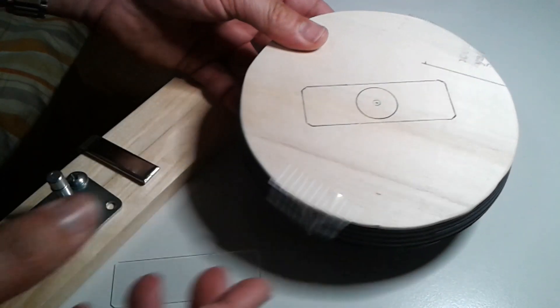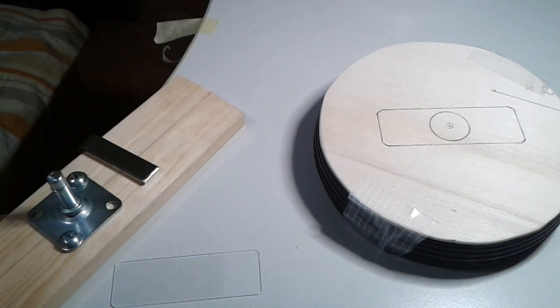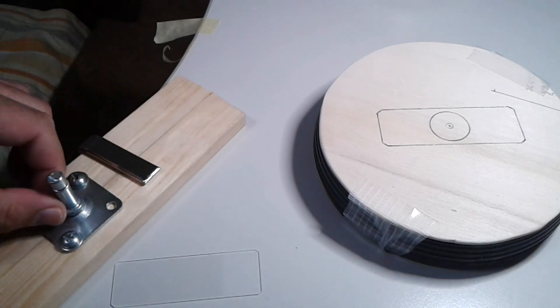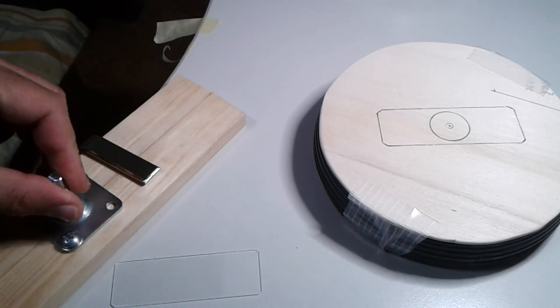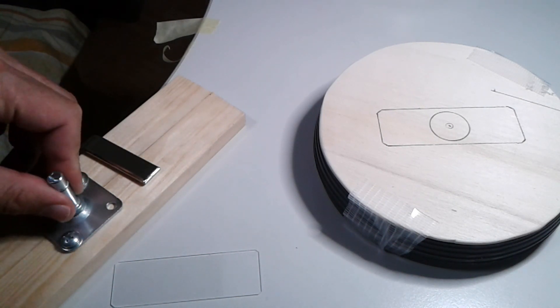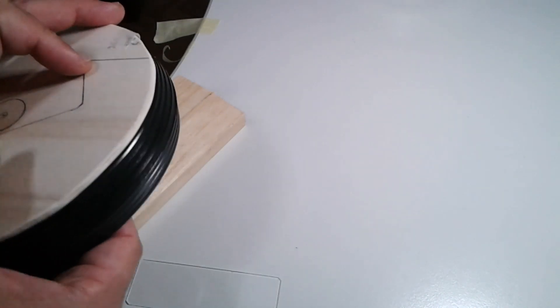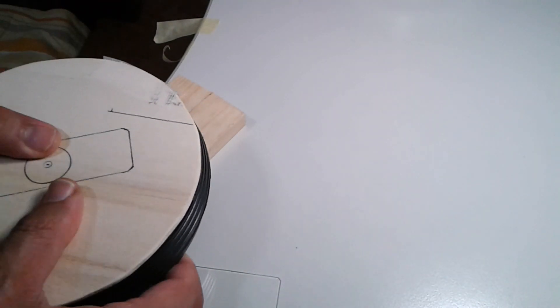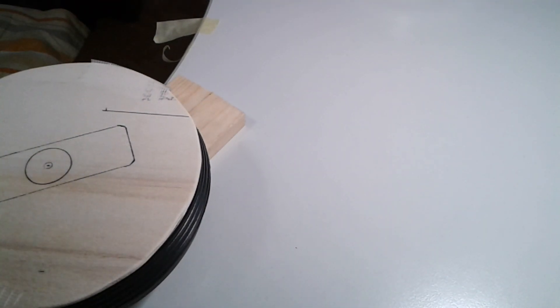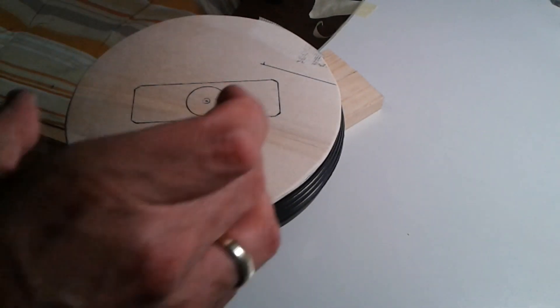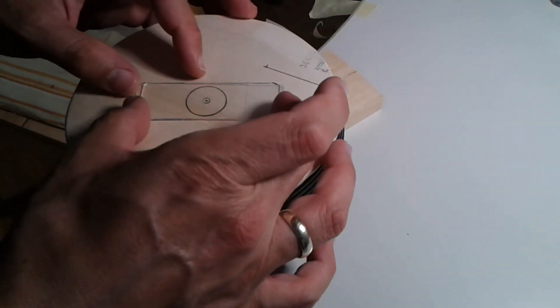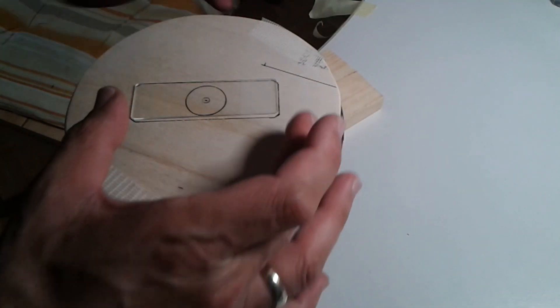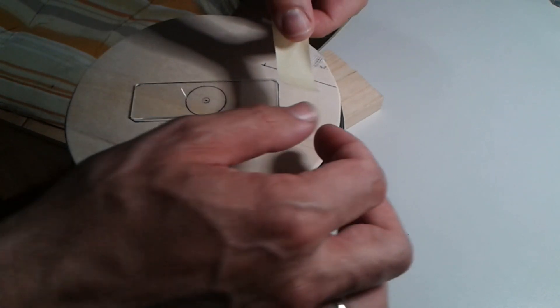On the left side here I clamped a piece of wood with this thing on a table. The slide ringing table wheel is how you put it on it. Then I'm going to place the slide here in the center.